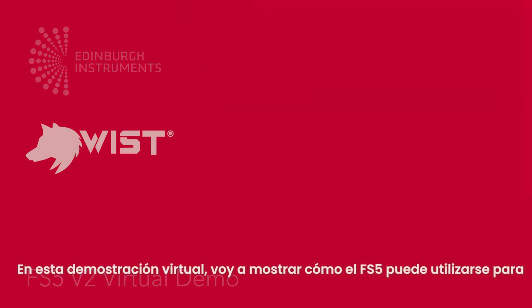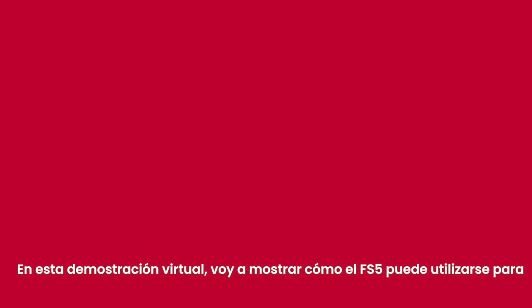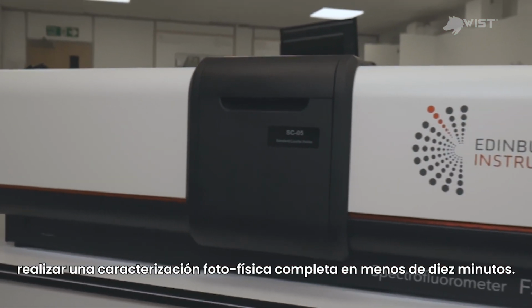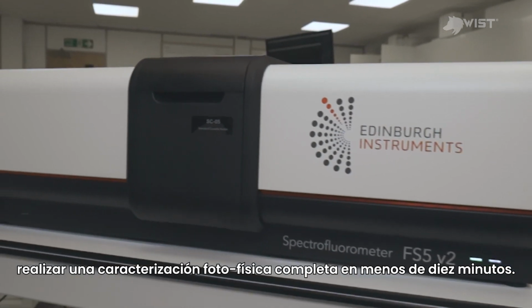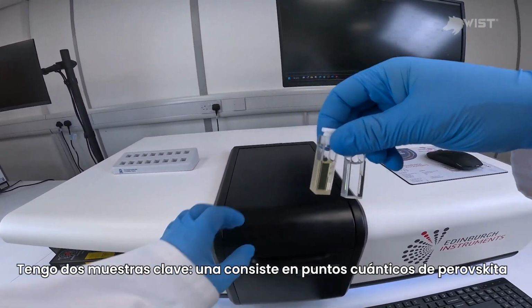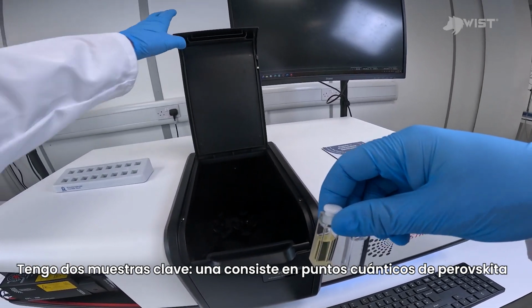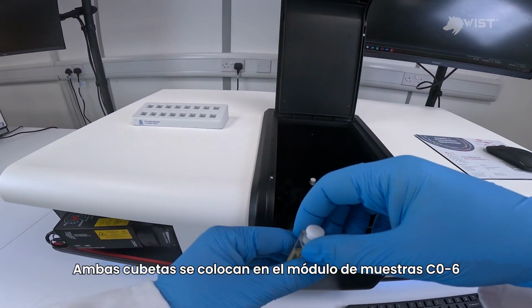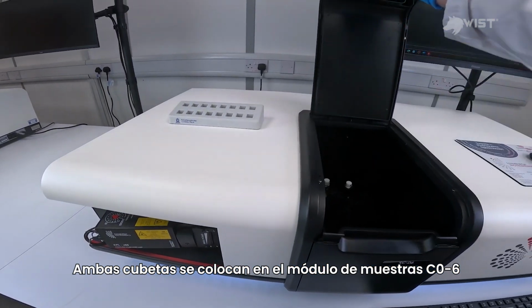In this FS5 virtual demo, I'm going to demonstrate how the FS5 can be used to perform a complete photophysical characterization in less than 10 minutes. I have two cuvettes. One is the perovskite quantum dots dissolved in cyclohexane, and the other is the pure cyclohexane solvent. Both cuvettes are placed into the SC-O6 cuvette sample module.